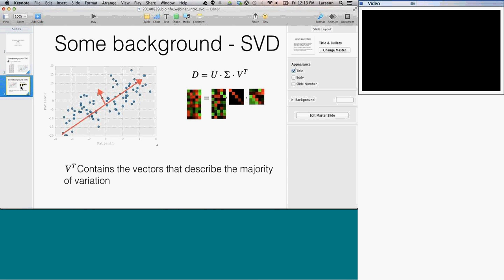So unlike last time, I'm actually going to run code, and we're going to look at fetching data, doing the singular value decomposition, and try to identify what these patterns are. I'm running everything in Python, so it's a Python notebook, and I'll leave this one available, and attach a link at the bottom in the comments to this video, so that you can download it and rerun it yourself and reproduce the results.